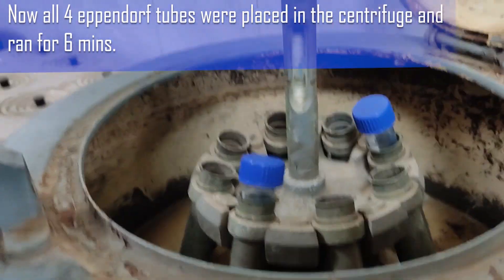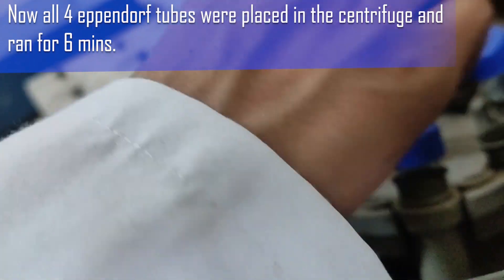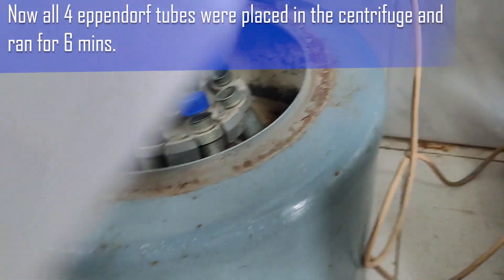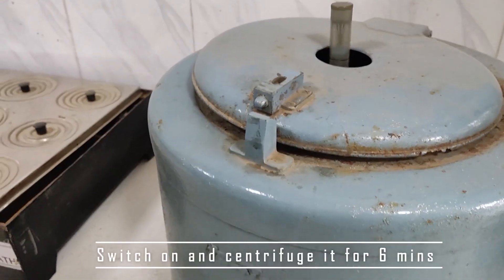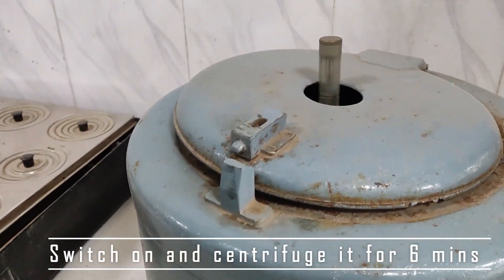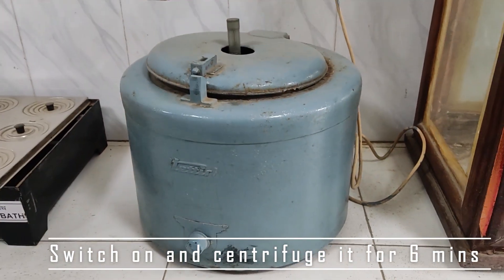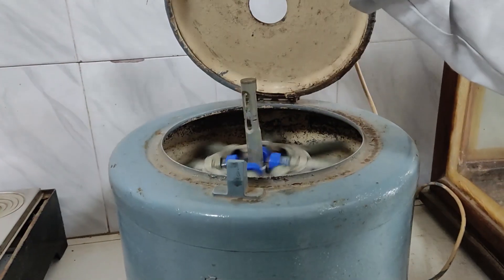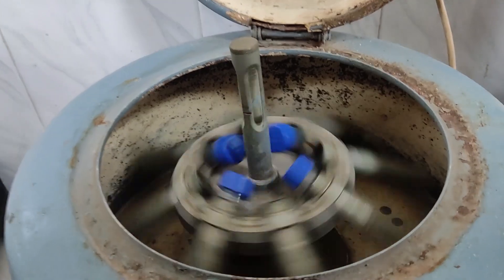All four Eppendorf tubes now need to be placed in the centrifugation machine. Run them for six minutes. Switch on the machine and leave it for six minutes.